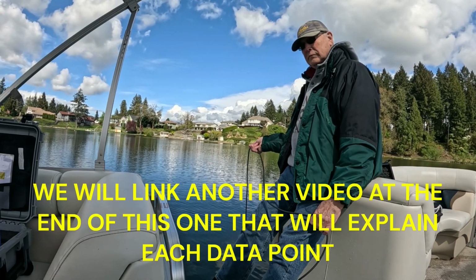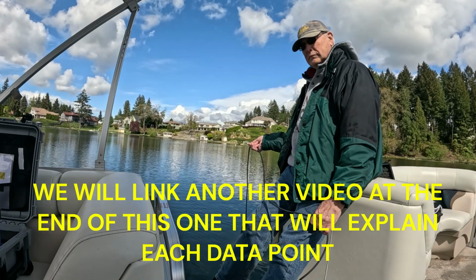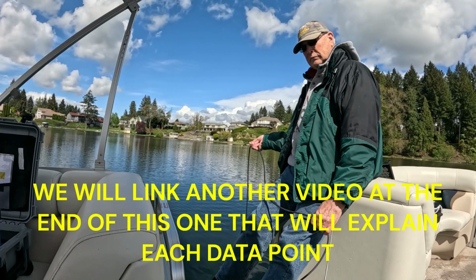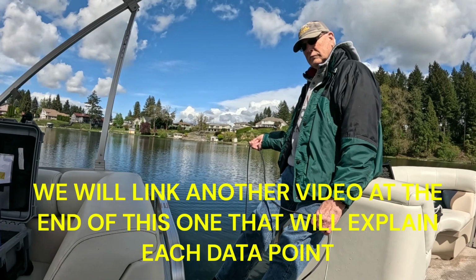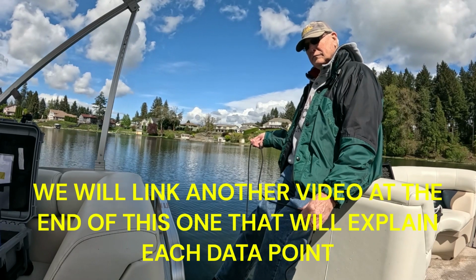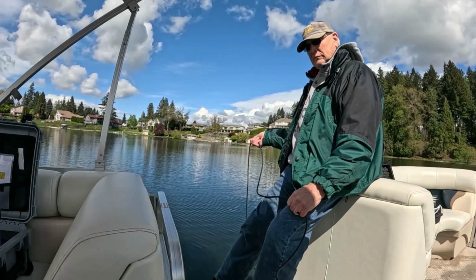4.5, passed it right there. There you go. So you're at 13.3. pH is 7.03. DO is 6.77. You just passed the thermocline. You're at 134.0 and 1.72 turbidity. So you're real close to the bottom.